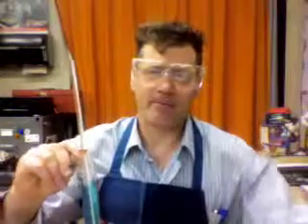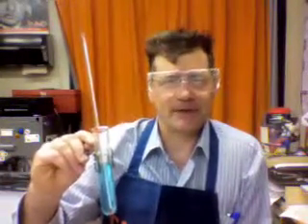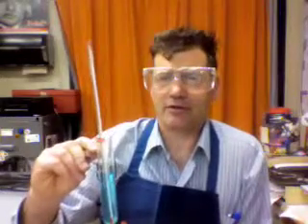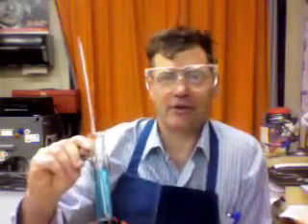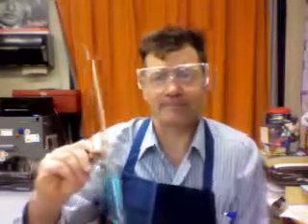Now, if the boiling point in this case is 100 degrees Celsius, I wonder what this could be. And if its freezing point was 0 degrees Celsius, I wonder what this liquid could be. Maybe you better go look that up. Good luck.